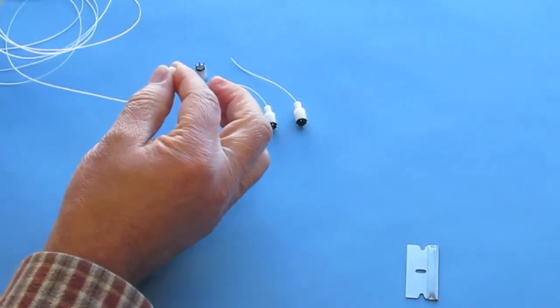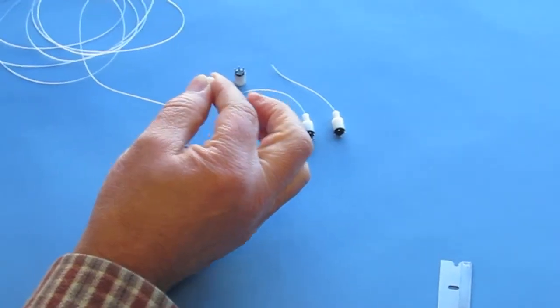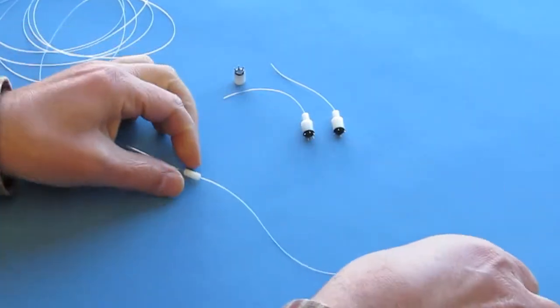The next step is to cut the tubing at its thinnest point and feed that into the tail section of the manifold.